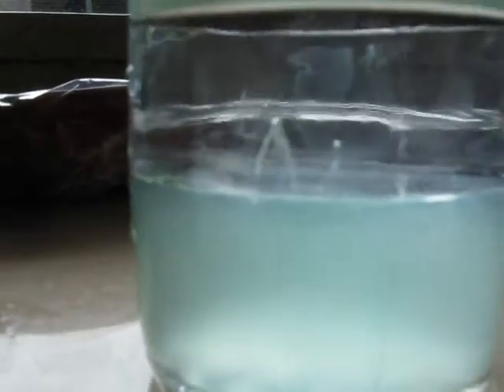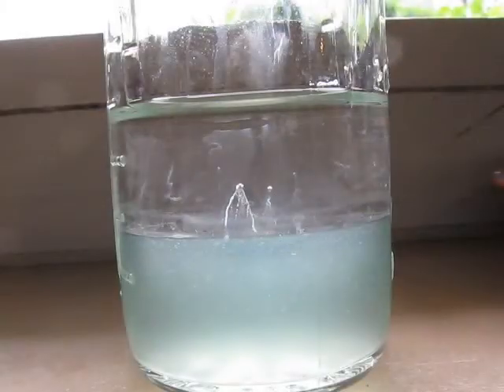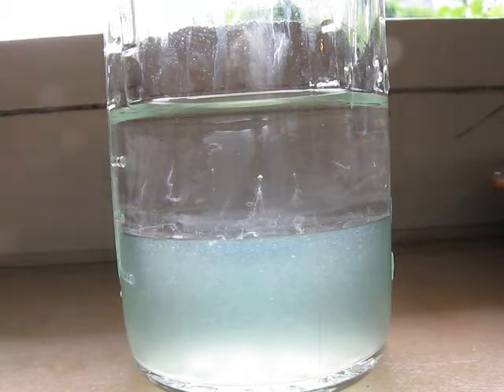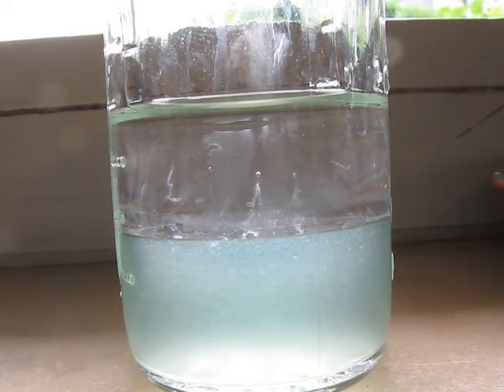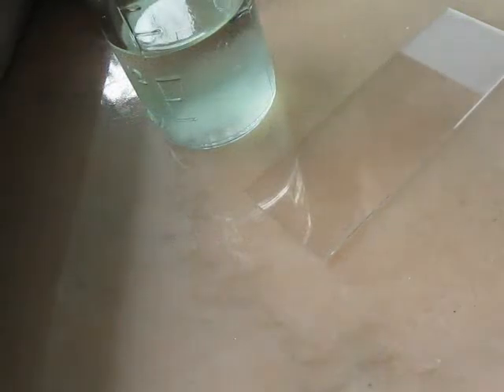So this didn't really work, which is actually good news, because it means you don't have to drain your own blood to repeat this experiment — you can just gargle with some salty water, which isn't too pleasant but is probably nicer than taking a blood sample. You can see another bubble with DNA — the camera can see it now too. I can see some more, but the camera can't. I will now try to get that bit of DNA out and onto a microscope slide so you can hopefully see it under the microscope.